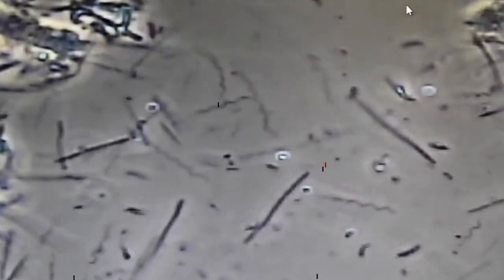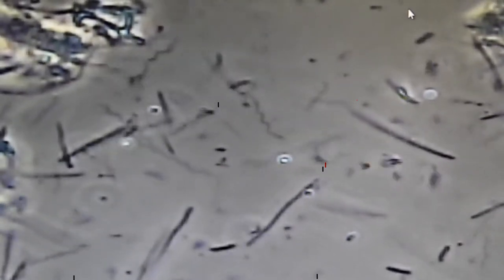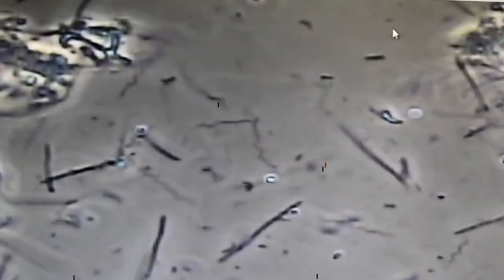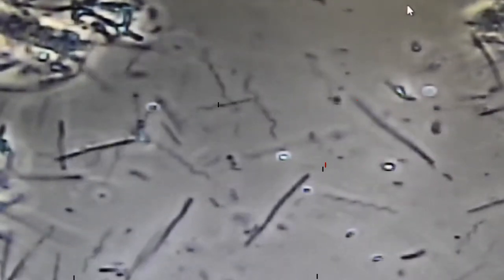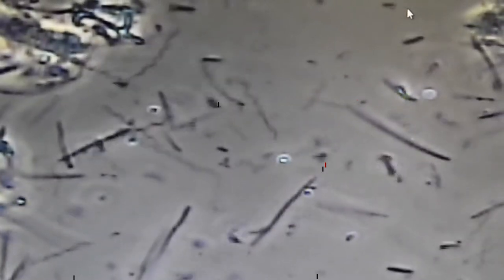Typically, we would score this slide by counting approximately how many spirochetes we see in the field, how many red blood cells we see in the field, and how many of different kinds of descriptions. Spirochetes are one of the things we particularly look for and are particularly a hallmark of significant periodontal infection.